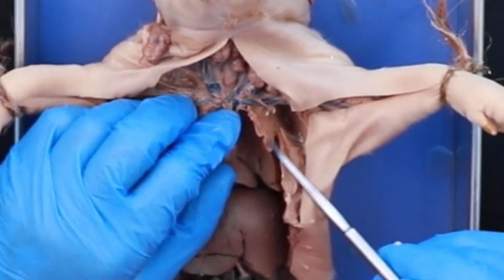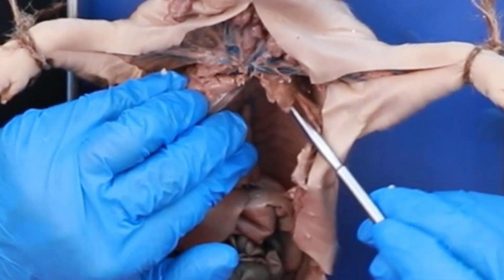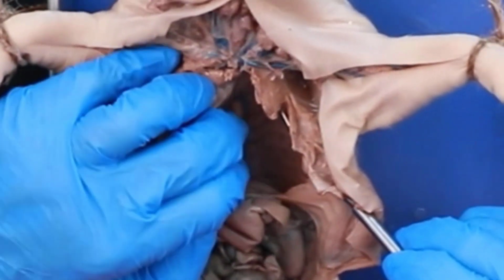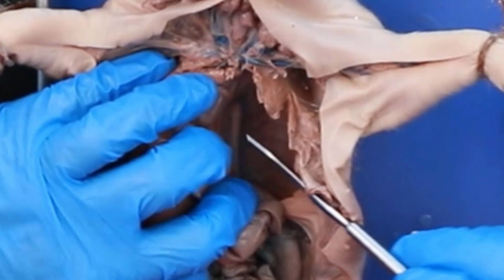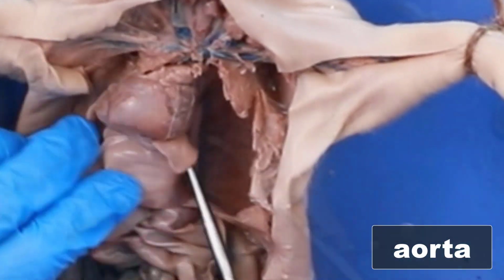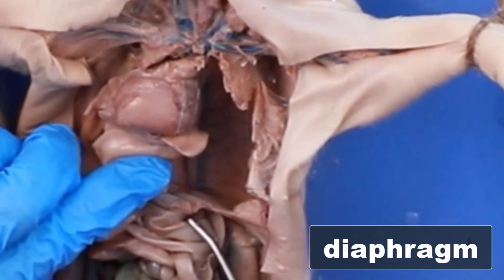All right, so we're going to come down the back of the pig, and you can see right here, see that vessel right here? That's the aorta coming down. So we're going to go here, and we're going to go through the diaphragm.